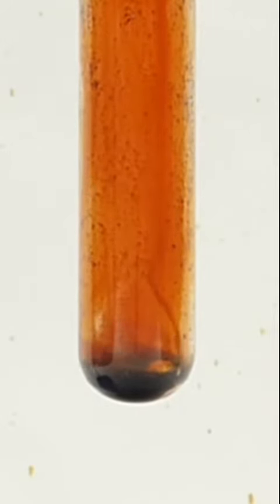At the bottom, I'm left with a bunch of dirty aluminum bromide salt and a small ball of aluminum metal.